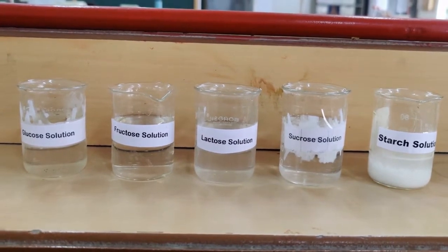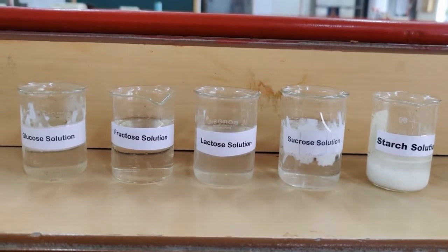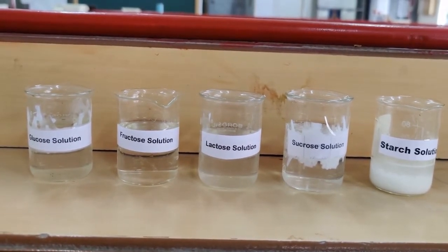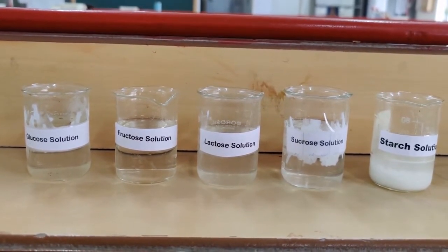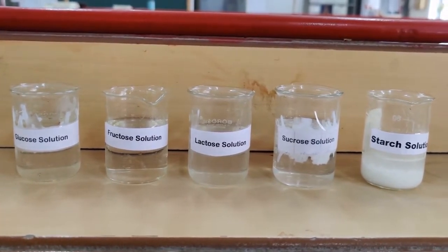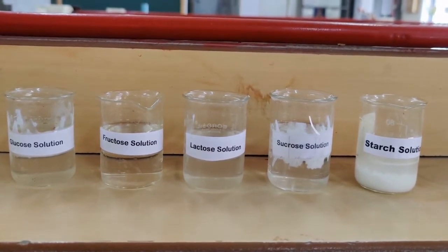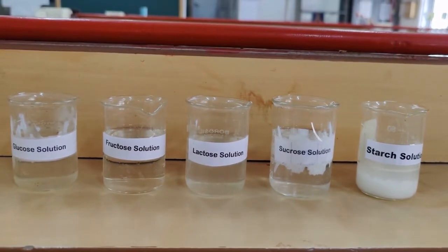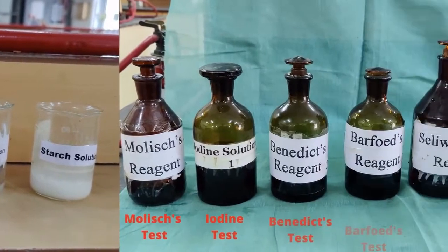In this demonstration, we are going to observe the general reactions of carbohydrates. Here we can see the monosaccharide solutions glucose and fructose, reducing disaccharide solution lactose, non-reducing disaccharide solution sucrose, and the polysaccharide solution which is starch. This one is a partially soluble colloidal solution compared with the monosaccharides, which are completely soluble.